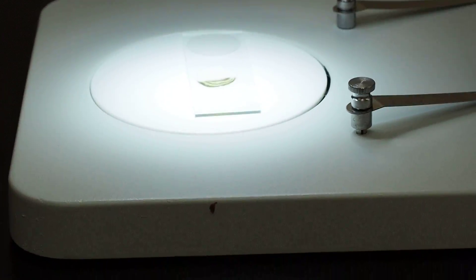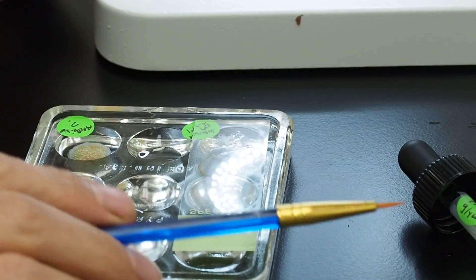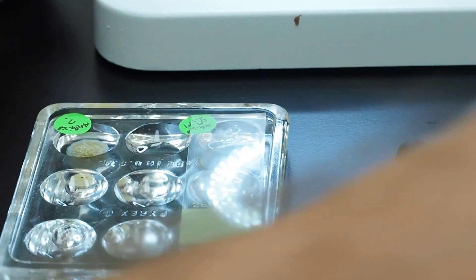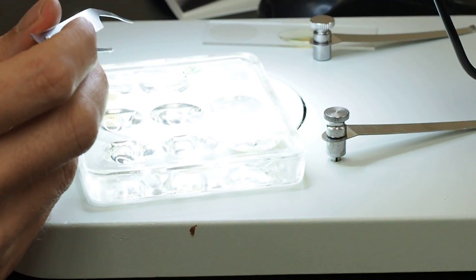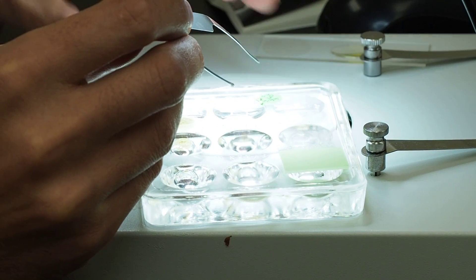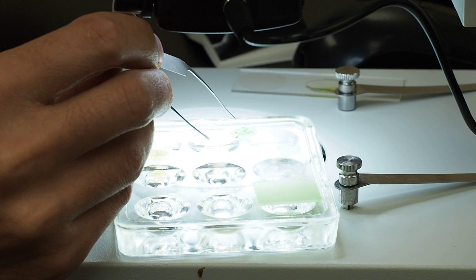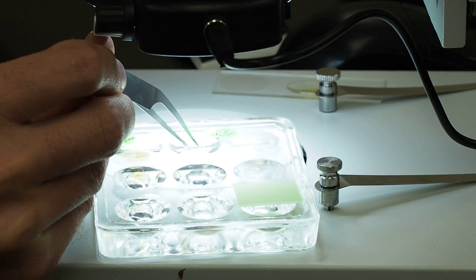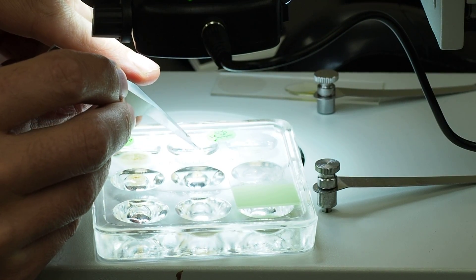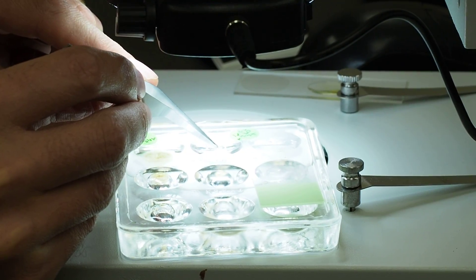So what we're going to do, we'll just take our specimen that's been sitting in clove oil. And you can use your brush, you have to clean it up afterwards so it might be easier just to use your tweezers that you already got dirty. And then put this to the side. Try and find our insect part underneath the microscope here. So we're just going to try and gently scoop it out. There we go.